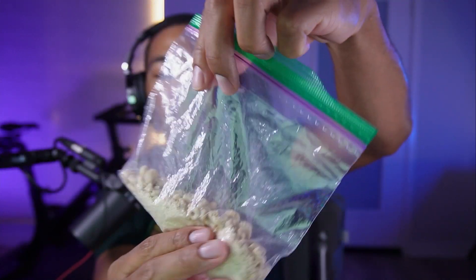We also have Cheerios, and for our authentic standard we have some fresh ground coffee in a bag. Because the bag will act as the same type of matrix, I intend to just test these samples in the bag to minimize probe contamination. When I've looked at coffees before I've exposed the probe directly to the fresh ground coffee, but then I'm constantly having to wipe the probe every few samples, so it's much easier to keep this glass surface clean by testing through the outside of the bag.